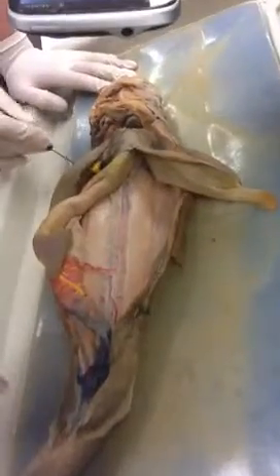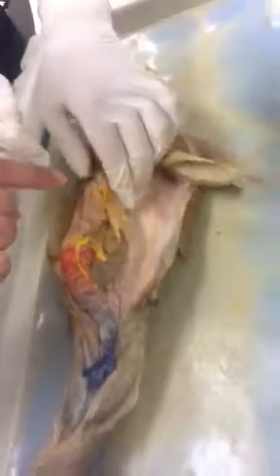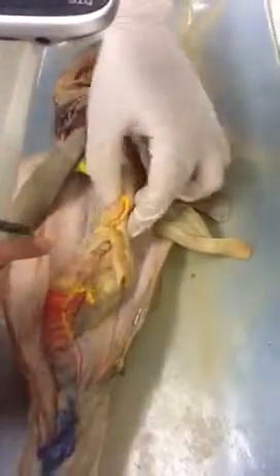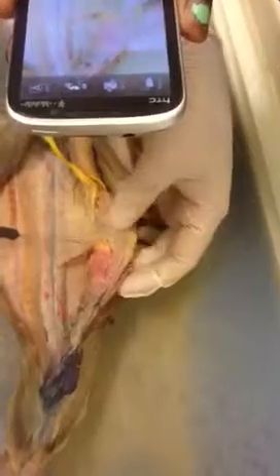There's the hepatic portal system. This gets annoying, so you have to be really careful here. That's your hepatic portal vein, that big yellow thing. And now there are three ways. If you pull up the mesentery, see that one that goes down here? It goes all the way down and splits two ways. It's your posterior intestinal veins and your posterior splenic.